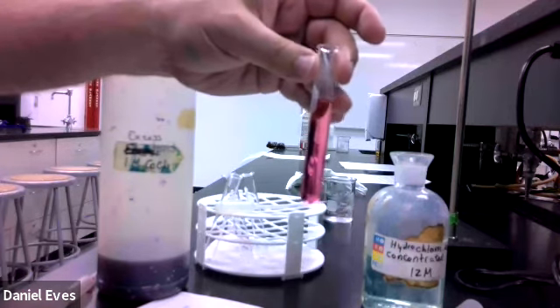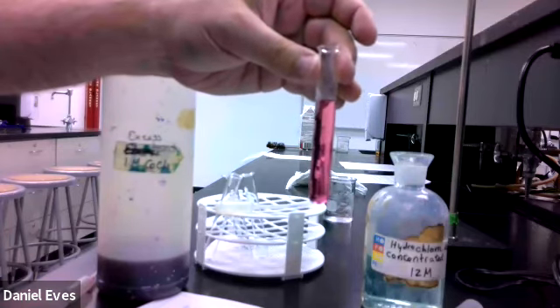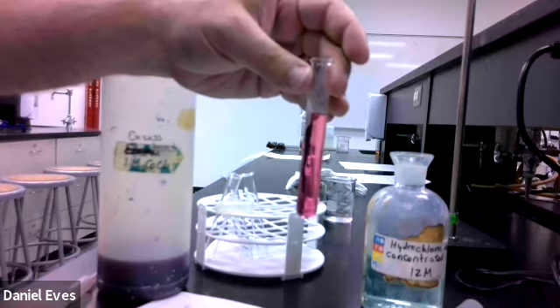So we surround it with water molecules, it turns red. We surround it with chloride ions, it turns blue. Now, we want to see what the temperature effect is for this. We need to devise our own reaction.